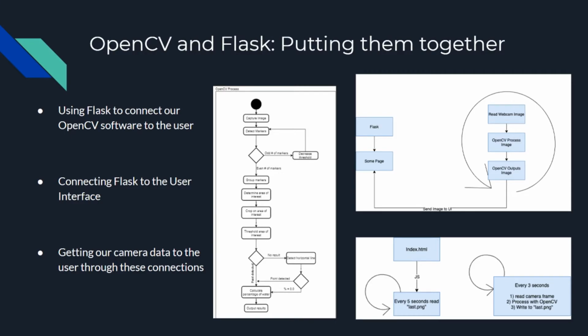Now the great thing about Flask is that Flask is able to communicate with OpenCV and our front-end user interface to connect these things. In the bottom right image, you see the logic then implemented so that this information is refreshed and this process is repeated every 5 seconds so that we get a constant update of the information. This is allowed because Flask is connecting that from OpenCV and connecting it to our user interface. This holistic process of connecting these three things together is what has allowed us to get our camera data to the user through these specific connections. And this is what allowed us to solve this problem.